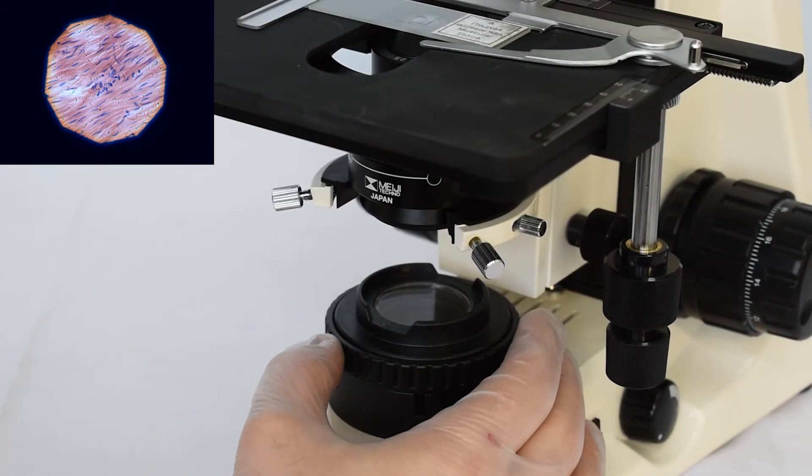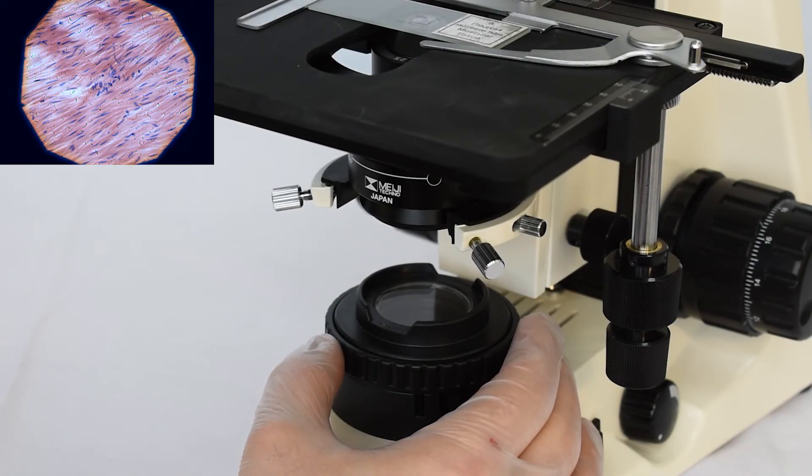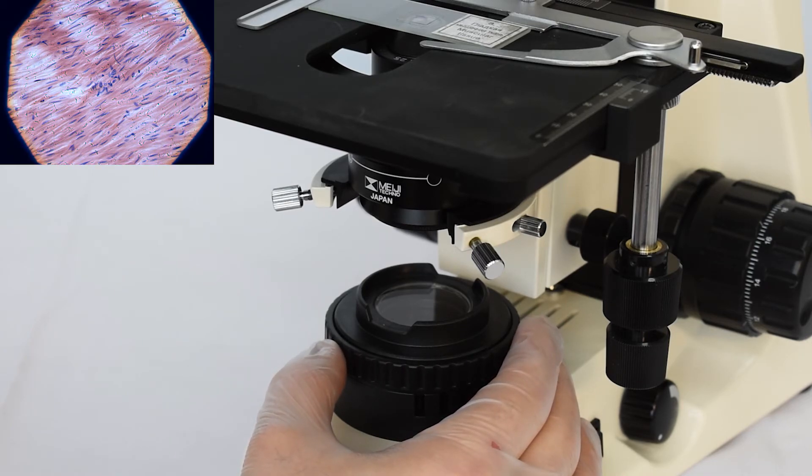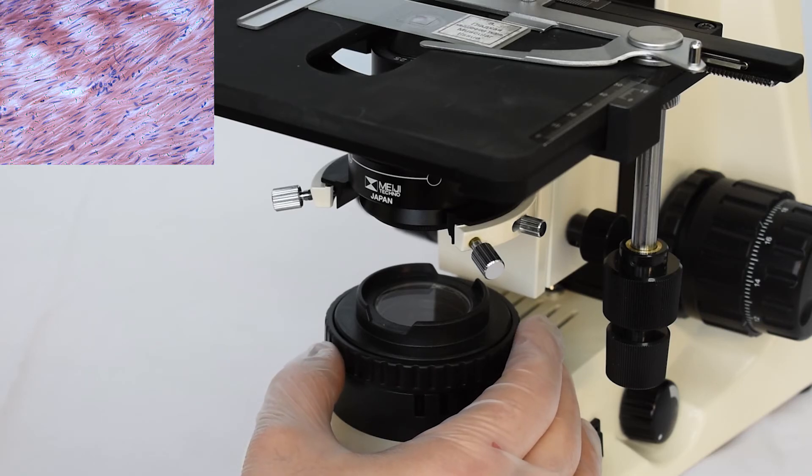After the centering process is completed, the field diaphragm must be opened so that the edges of the polyhedron extend beyond the boundaries of the field of view, but nothing more.